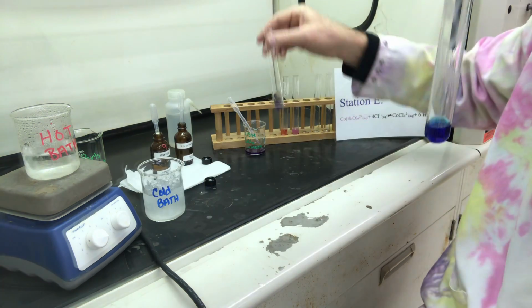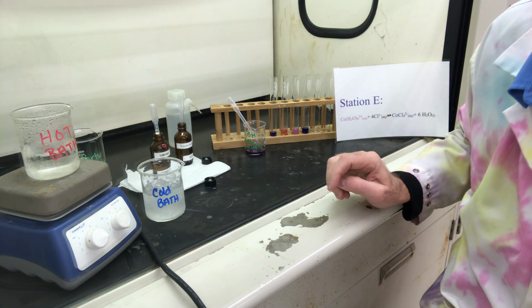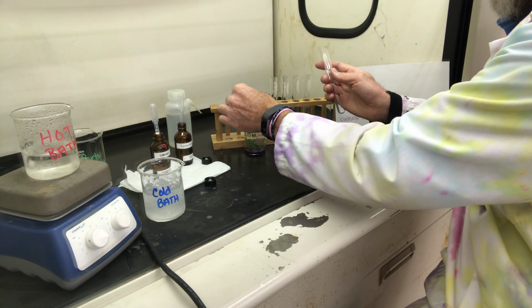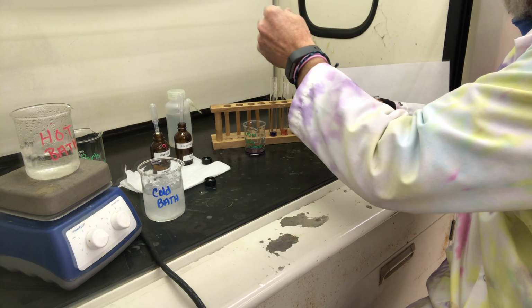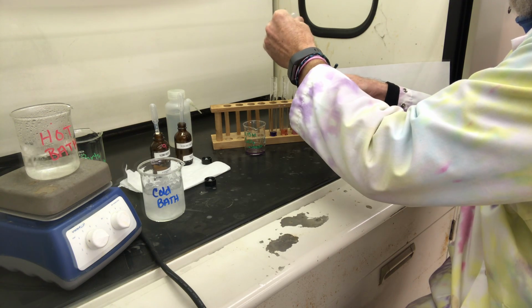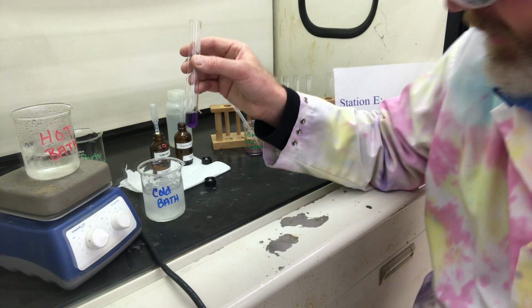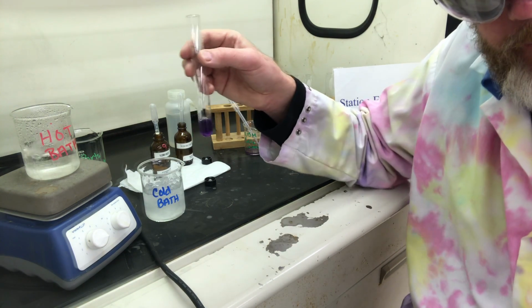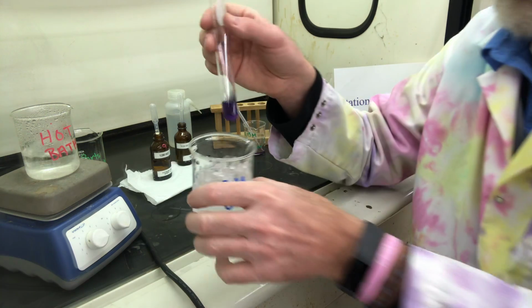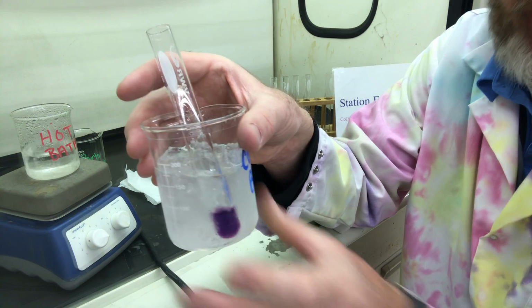Okay, that was test tube 4, excuse me. Test tube 5, we're going to start with a couple of drops. I'm actually going to add a little bit more. Hopefully it just makes it a little bit easier to see. Now, as you can see here, I have a hot water bath and a cold water bath. I think this one's a little bit easier to see if we go back and forth between the cold and the hot. So let's do this one. Let's put this on ice. And we're going to leave this here.